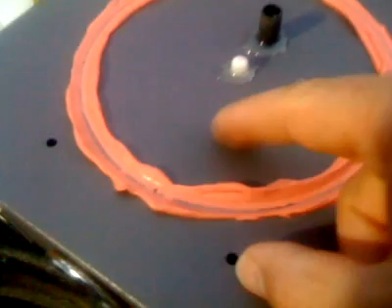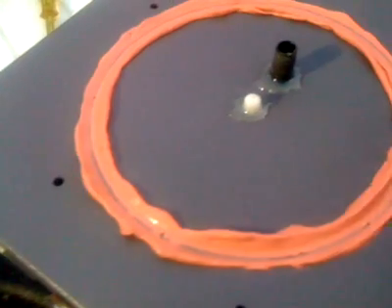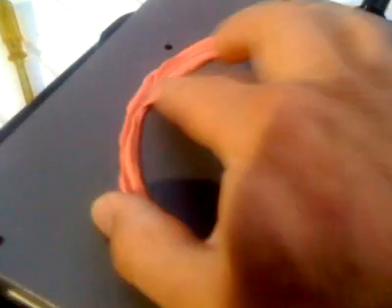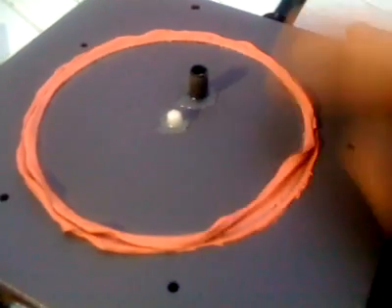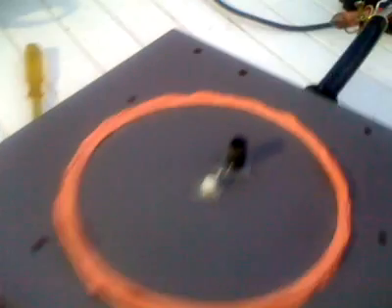My seal on top of the test bed is just kids' Play-Doh, and probably what I'll do before I put the bowl back on is squish this over so that I've got a nice bit to suck down on again. Because obviously it does get squeezed out from underneath the jar when the vacuum comes on. So that's squished over, got something to sit on.